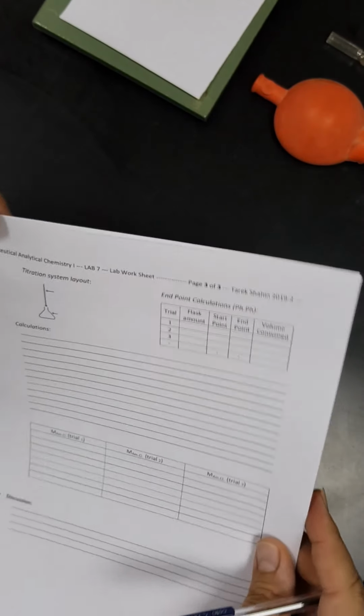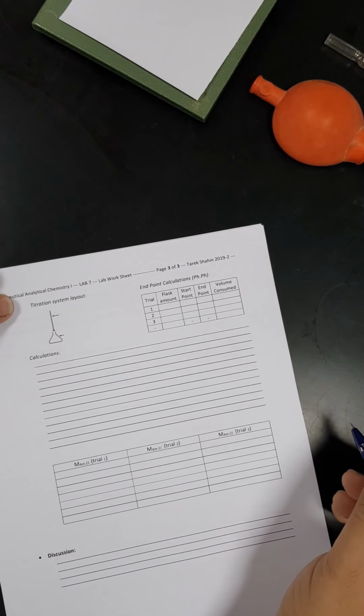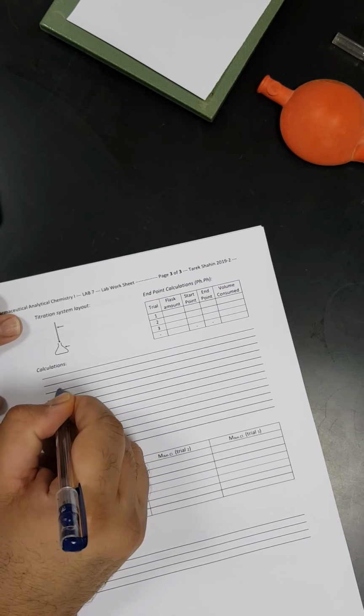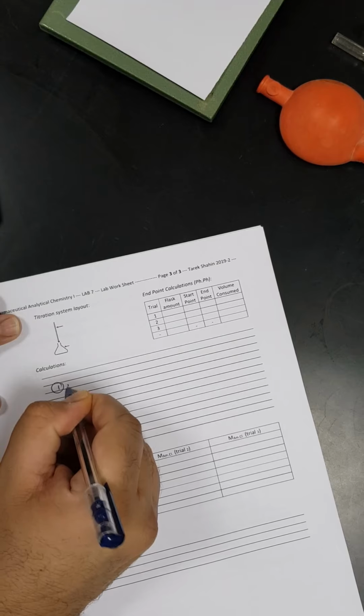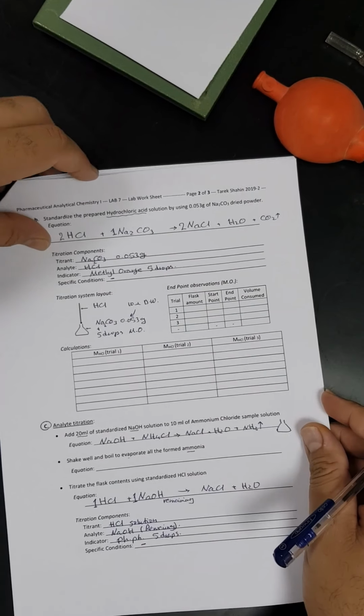Okay, so let's move one step forward. After doing the experiment, we will get the results and then we will start the calculation. Calculations will be greatly dependent on the following procedure. We have to subdivide the titration here, which we have already done, between the remaining amount of sodium hydroxide and the HCl solution.